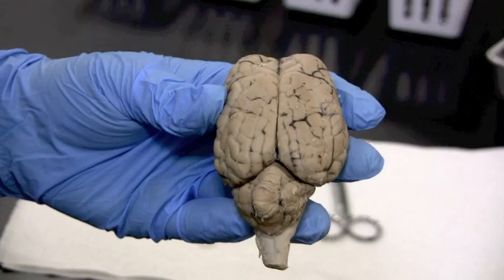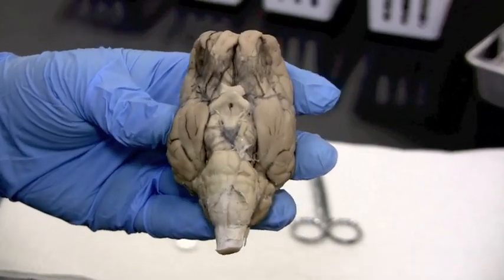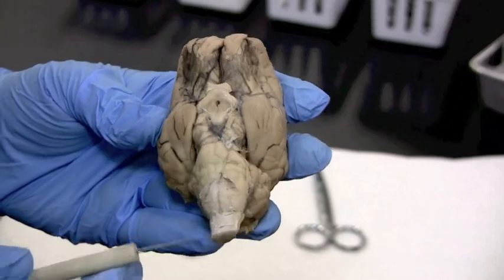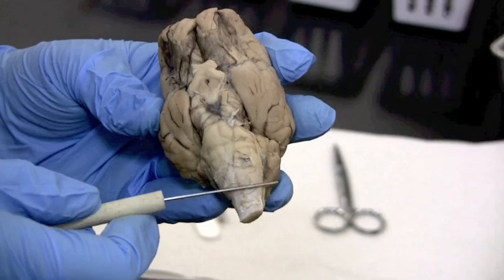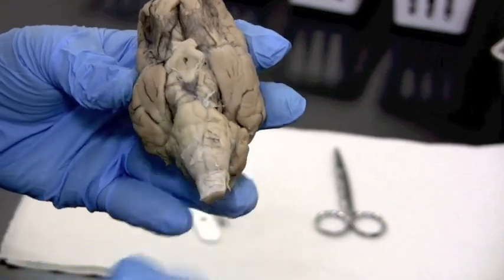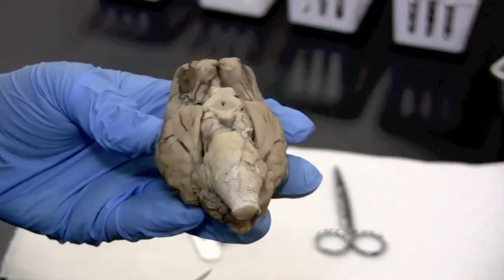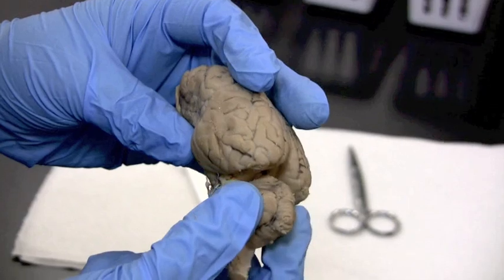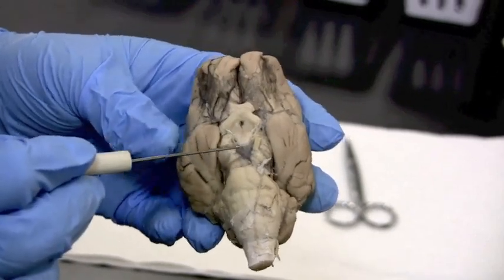That was the superior view of the brain. Now we're looking at the inferior side — the underside. You can see the brainstem pretty well down here. It starts with the spinal cord, and when we get up to the first bump area, that's the medulla oblongata — we transition from the spinal cord to the medulla there. The second set of bumps is the pons. Those are the two ventral parts of the brainstem, and then we have the cerebellum right behind it.